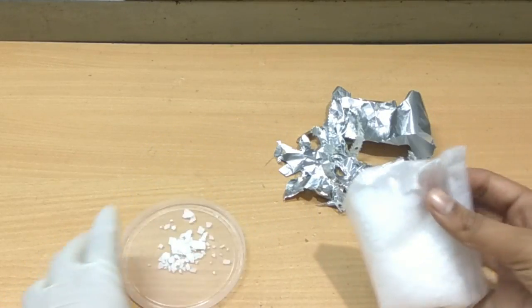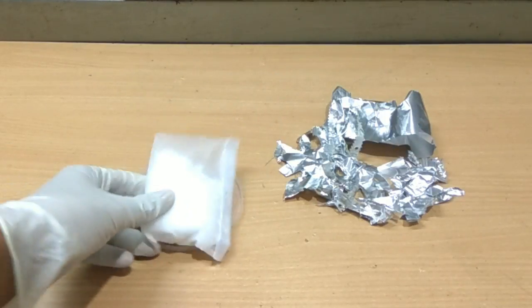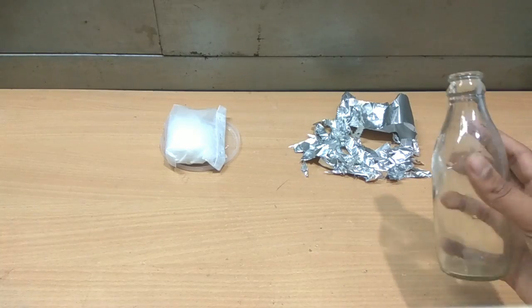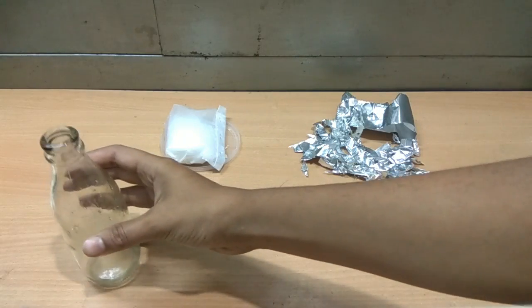Perform this experiment only under adult supervision. We need a glass bottle for performing this experiment as the reaction is exothermic.